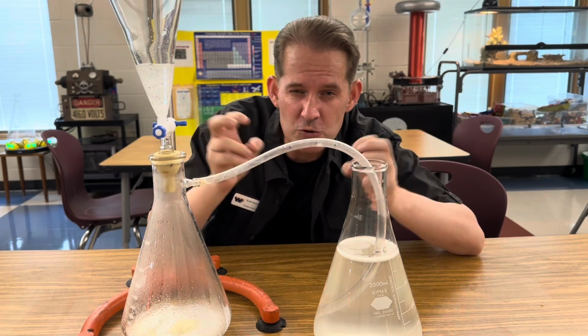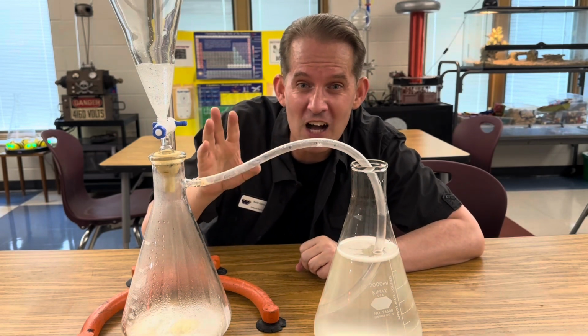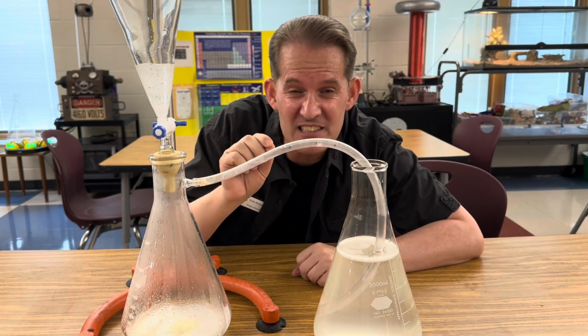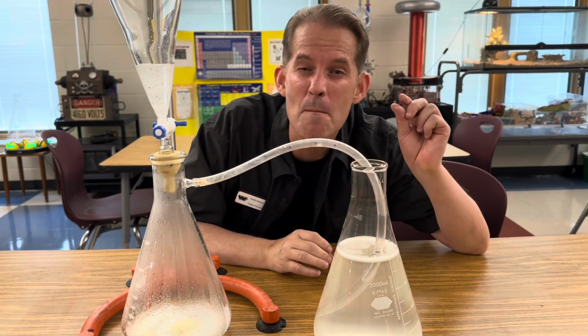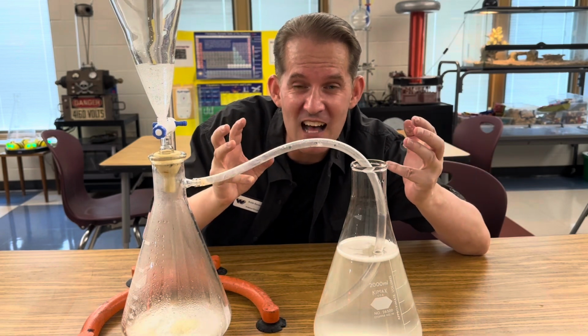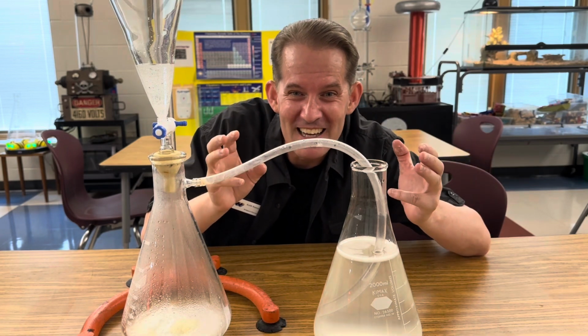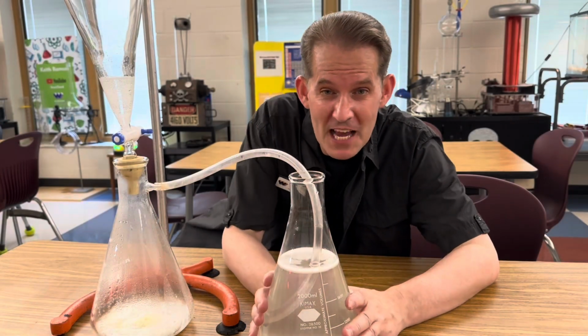And as those molecules bump up against each other, their electrons give off photons of light that are exactly 634 nanometers in length. Remember, a nanometer is just a billionth of a meter. And through the light spectrum, that appears to us as the color red. Just an amazing reaction. Now let's talk about this part of the apparatus.